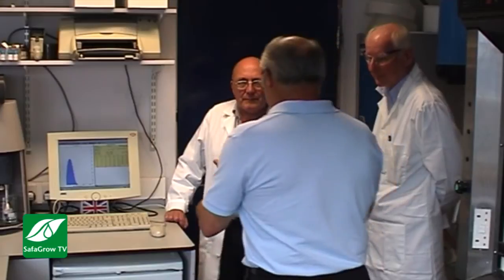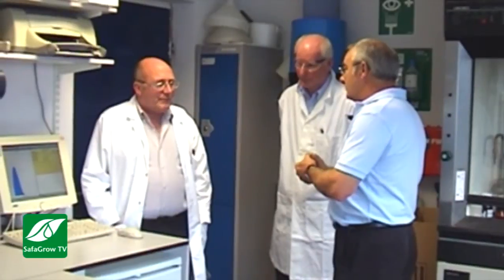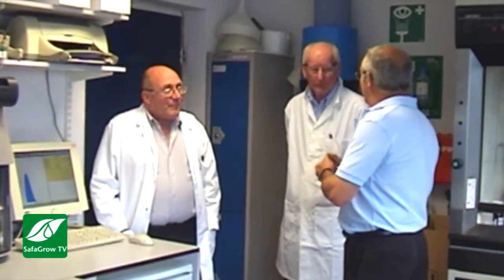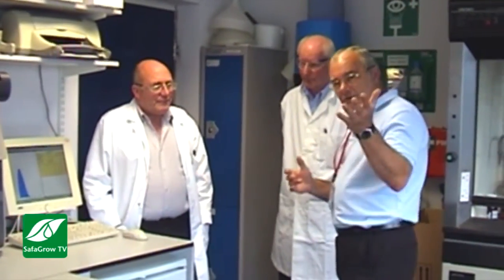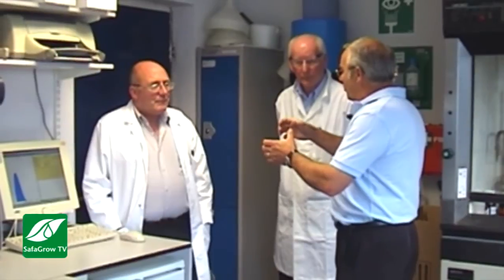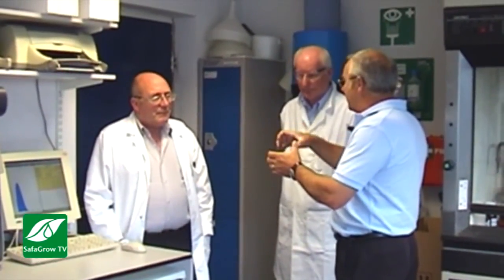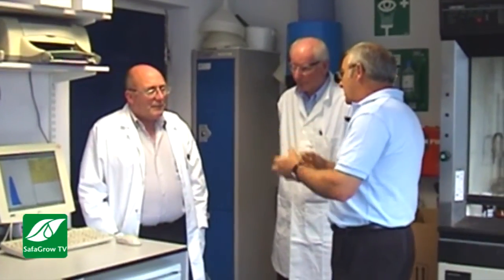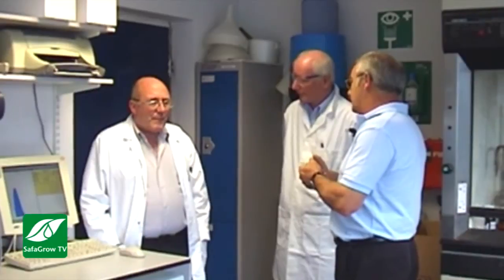Okay, one of the things I've noticed since starting this morning is how many technical phrases you guys use in your working life. I run slightly more simplistically, only slightly, but simplistically. I want to know what these phrases mean, and I keep picking up the word viscosity, which you look at on another piece of equipment over there. I think I understand it in terms of when I pour oil out and it's cold, it's slightly thicker, and then when the oil gets warm it goes slightly thinner. What influence does the word viscosity play with regard to product?